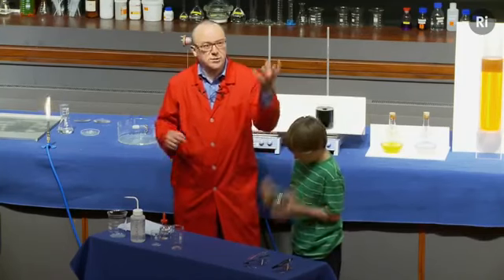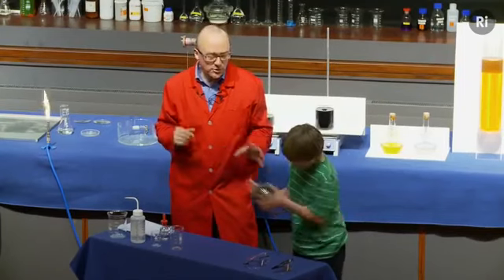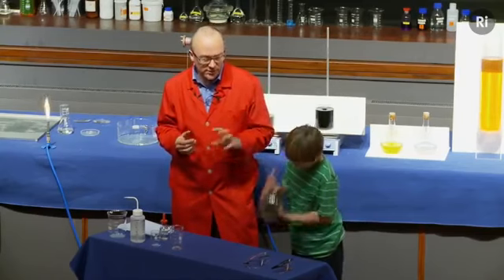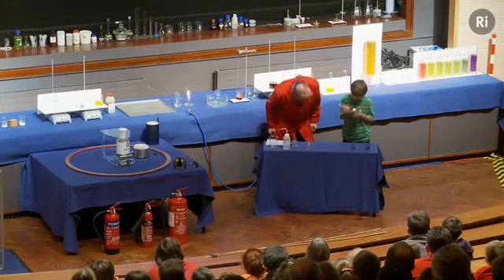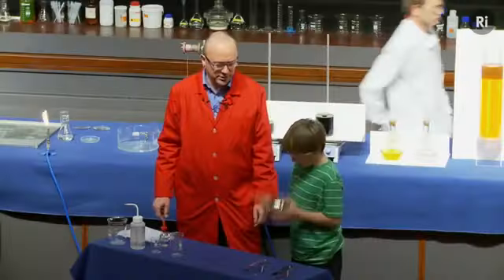And you'll all have seen those decorations that you get at Christmas, those spheres that are shiny, and they're made using this chemical reaction. The little balls of glass, and the inside is coated with silver using this kind of chemistry. Doing really well. Okay, let's just have a quick look. Almost there. Keep going a little bit longer. Still looking a little bit dark.